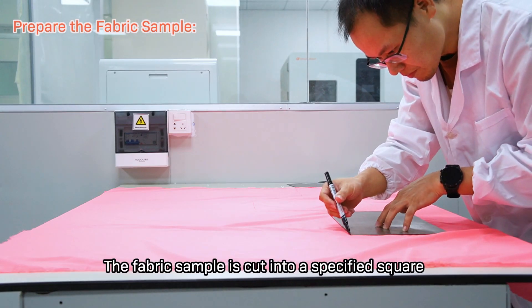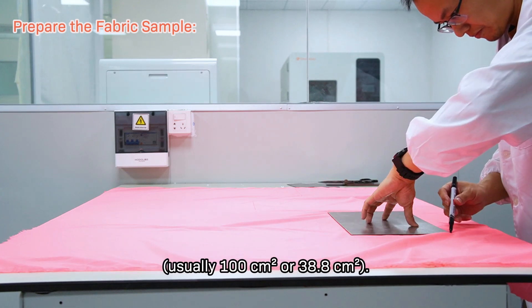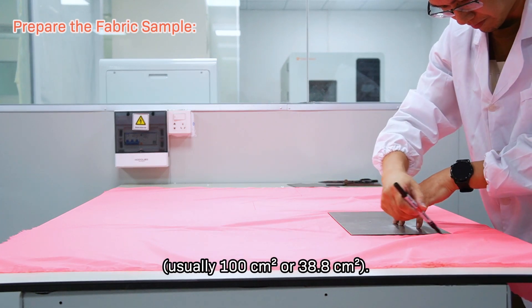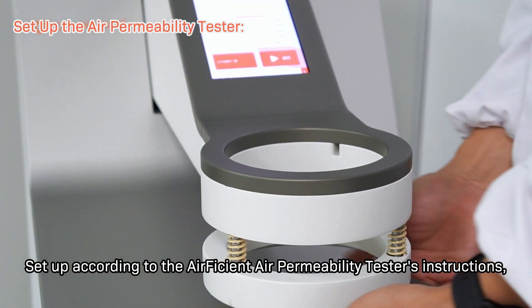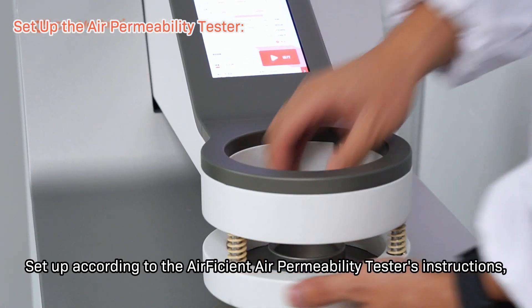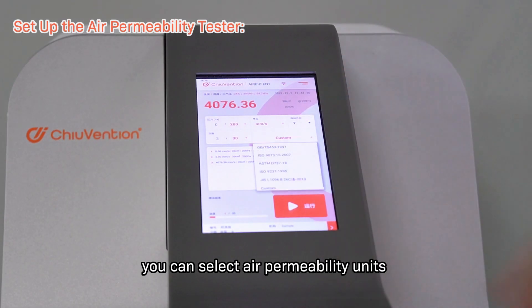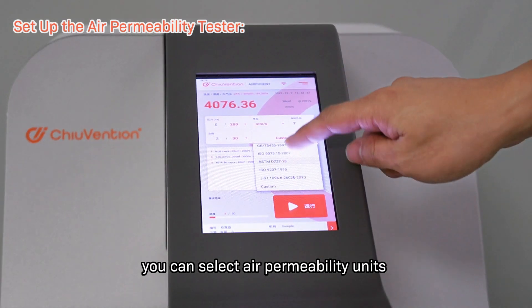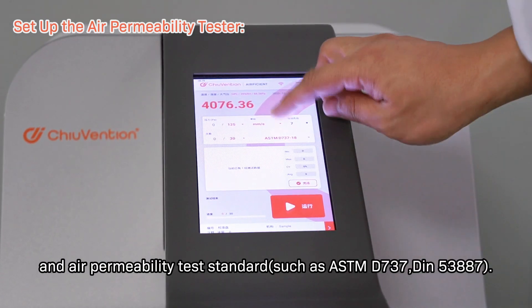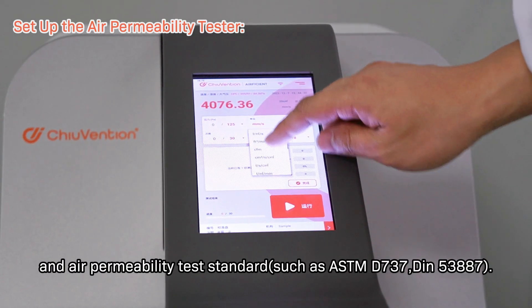The fabric sample is cut into a specified square, usually 100 square centimeters. Set up according to the air permeability tester's instructions. You can select air permeability units and a test standard such as ASTM D737.